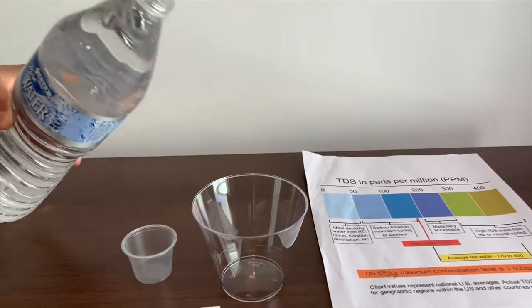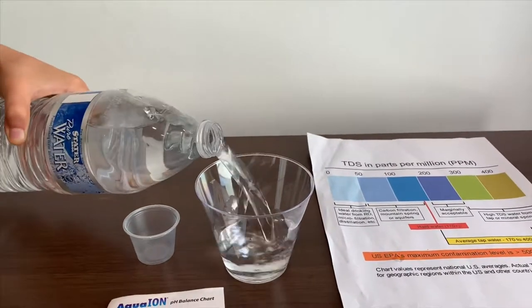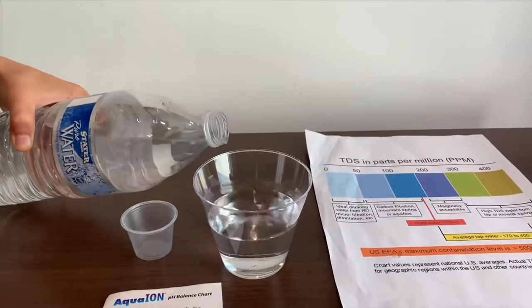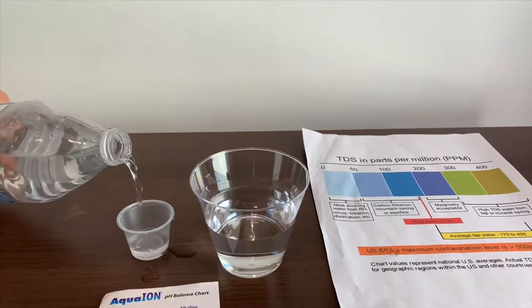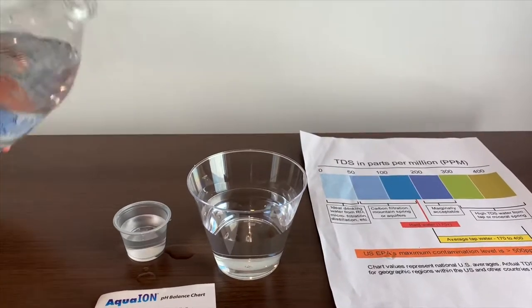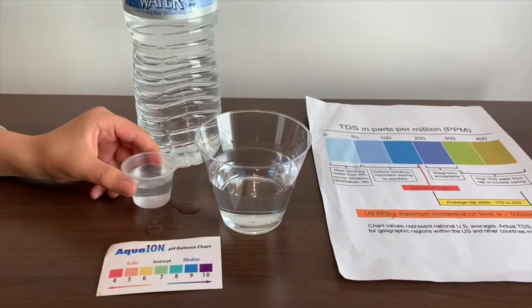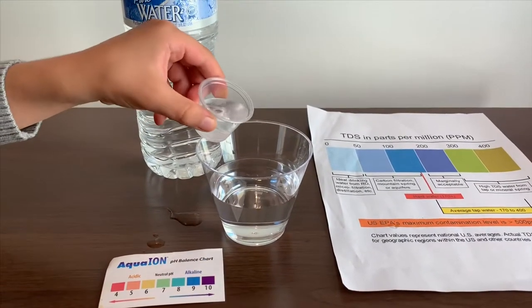Let's pour some water in. This is a little too much for the pH. Let's pour some in the TDS.